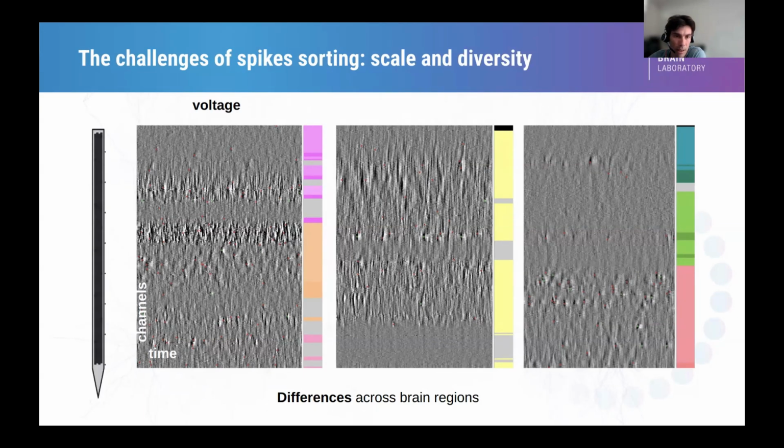All of the blobs you can see in dark here are spikes, and they are tagged here with little dots. And as you can see, the shape of the spikes, their frequency, their relationships with other spikes is really different depending on where you are in the brain. So on the right here, we're in the cortex, in the visual cortex, on the top. In the thalamus here, you see the spikes are much smaller and much more frequent than in cortex. Here, this is the cerebellum, where you can see the spatial signature of those spikes is very wide. And here, this is the midbrain.